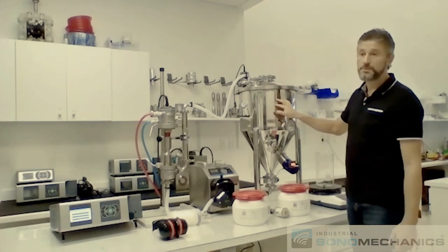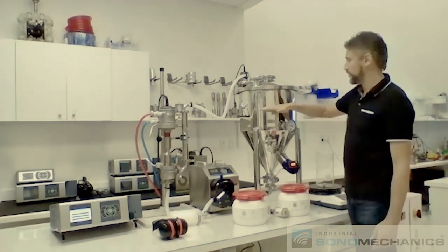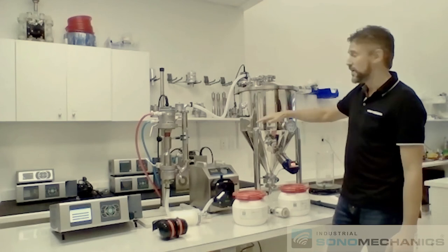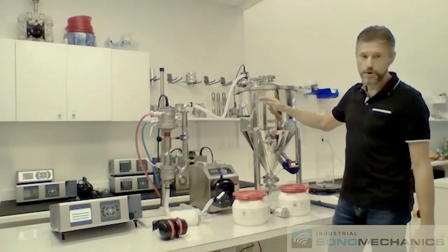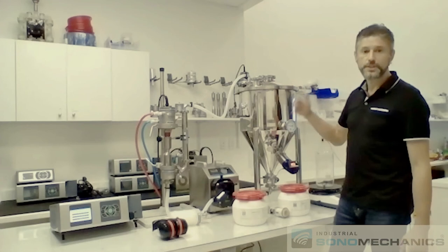Or you can just give it approximately an hour for every 20 liters. So if you're processing 20 liters, it's going to take an hour. If you're processing 40 liters, it's going to take two hours. You can just run for two hours and stop.